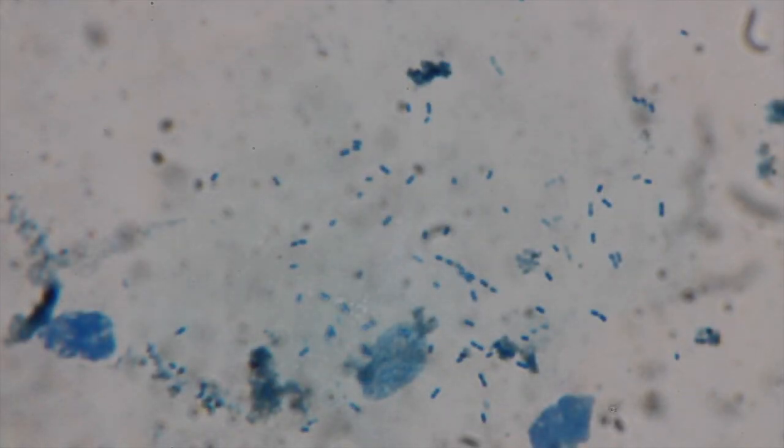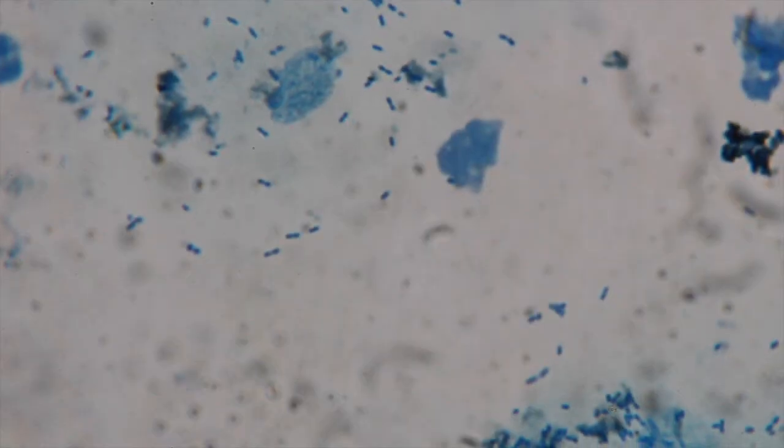Look at it. Beautiful. There we go. Nice. So the bigger blue dots then are the nuclei. So we can see 1, 2, 3 nuclei in this image. So there's 3 cheek cells kind of on top of each other. Then you can see all those nice little blue dots. Those are the bacteria in the sample. So a lot of bacteria on these cheek cells.